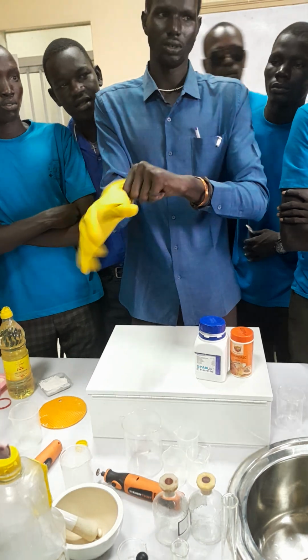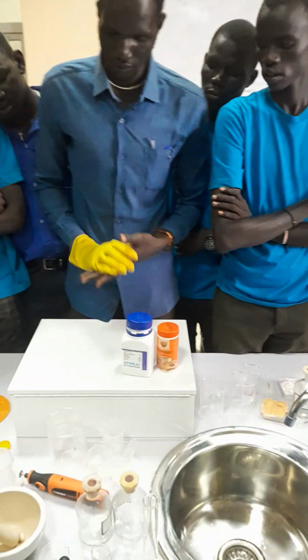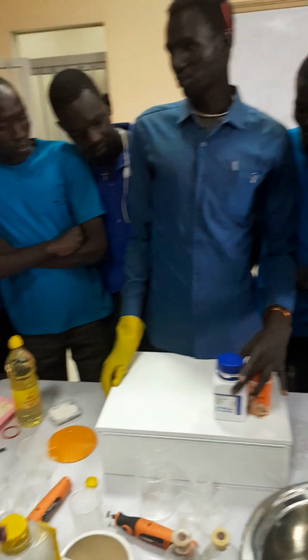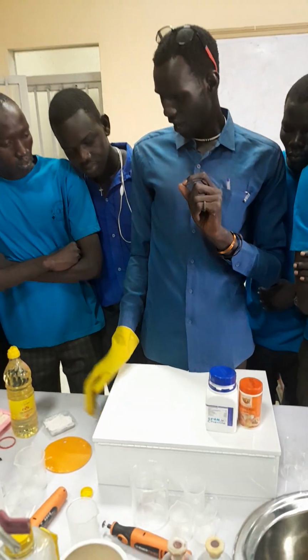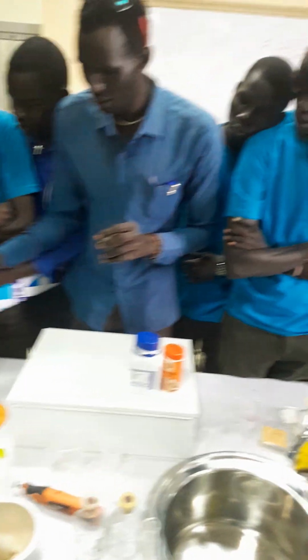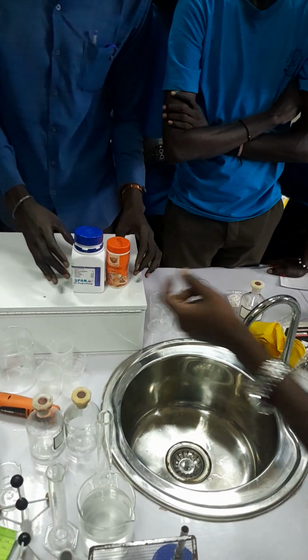Maybe I will try to tell you. Now, if you want to make your soap, first, you need to have the sodium hydroxide, the water, and the oil. Now, our oil is here. Excuse me, sir, kindly hold this one up like this. These two, yes.